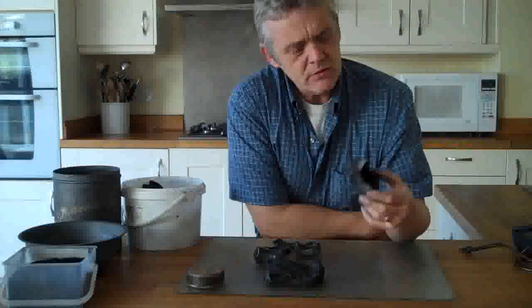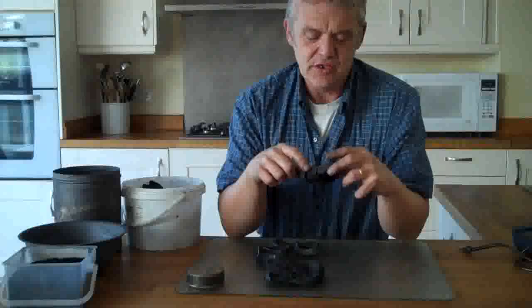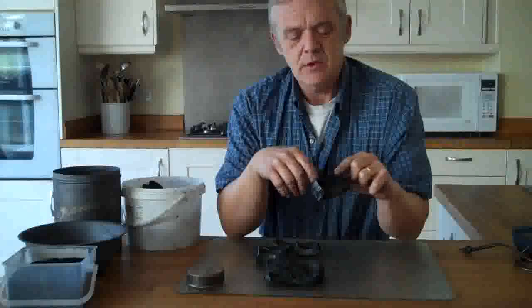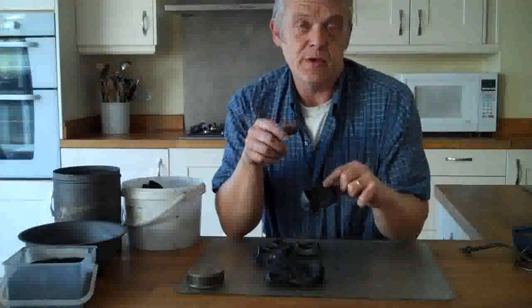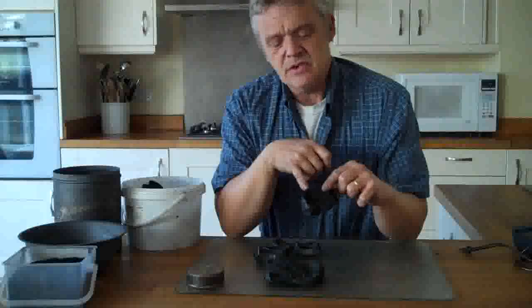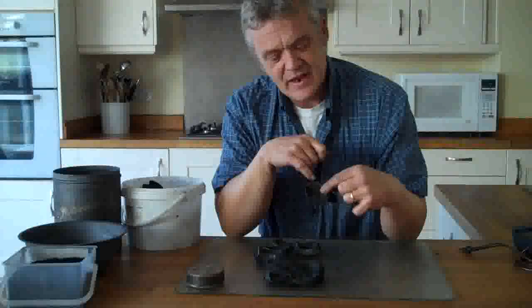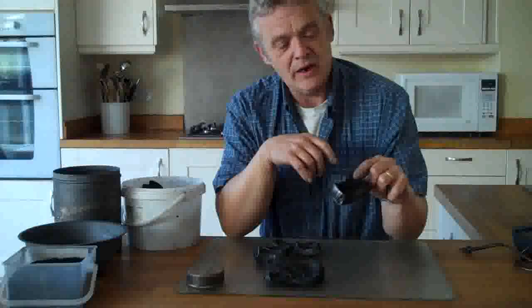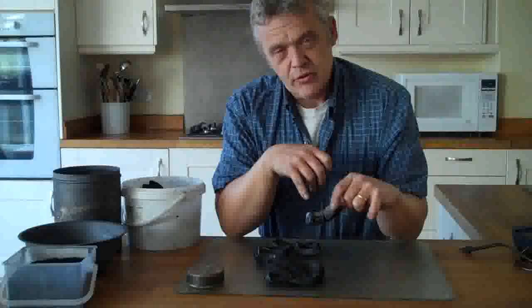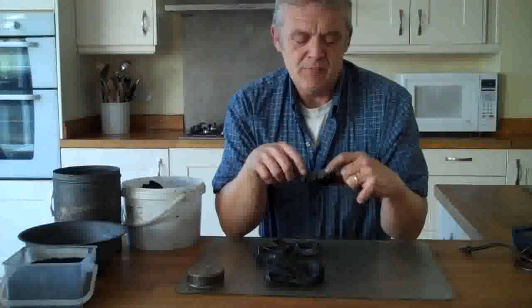You can see there's quite a lot wrong with it. The three centimetre ones have obviously been bowing, and that'll be because of the cut of the timber. There's a hell of a lot of shrinkage — they were pretty wet when they went in. I probably heated it too quickly; instead of doing it over an hour and a half I probably needed to do it over six hours. But there has been no reduction of material, the wood grain is still there and quite clear, it's very silvery and graphitic. It's a really nice material, and it will be porous.